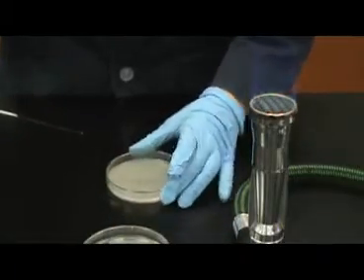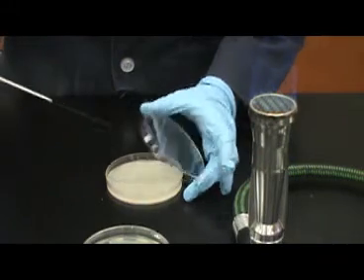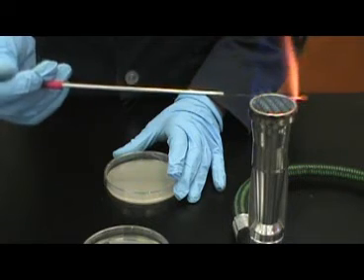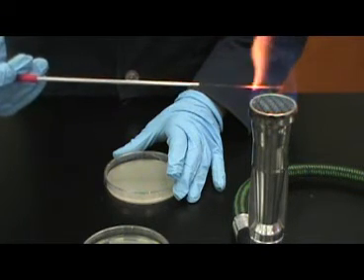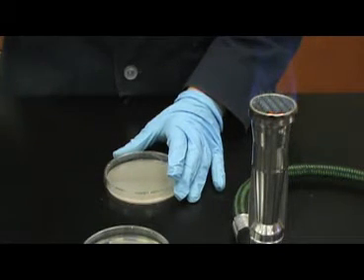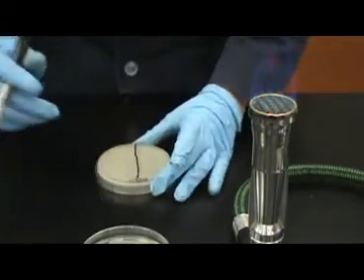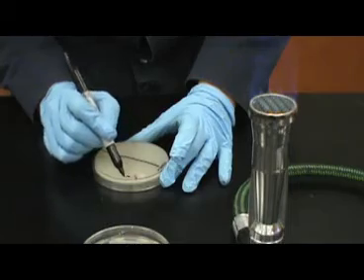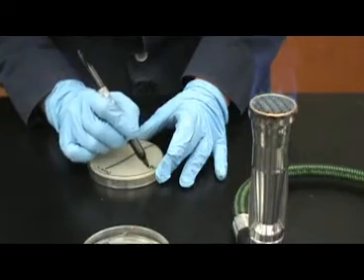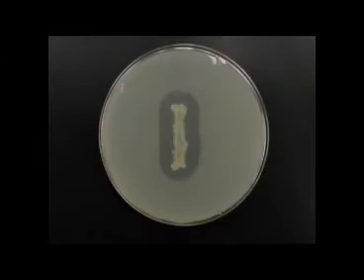There is no need to stab or puncture the agar during inoculation. It is a simple, straight-line plate inoculation. Using a straight line will make the results easier to read after incubation. Once you've completed inoculation of the plate, sterilize the loop and be sure to label each half of the plate with the bacteria with which it was inoculated. Once your plate has been labeled, place it into the incubator until the next lab period.